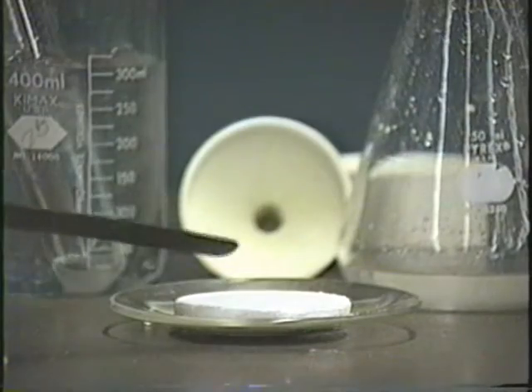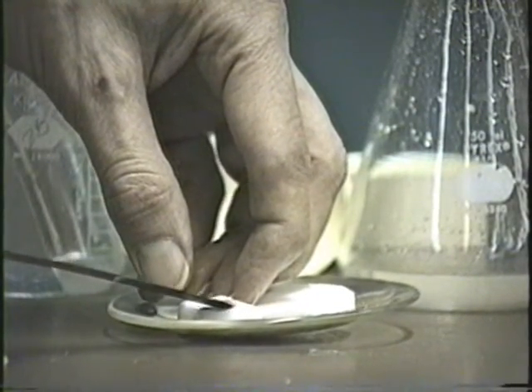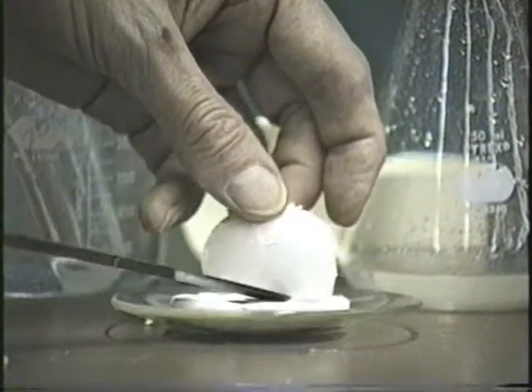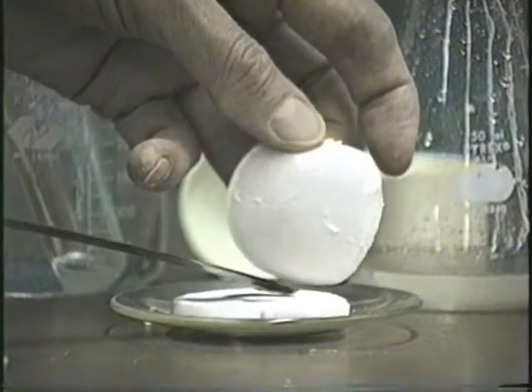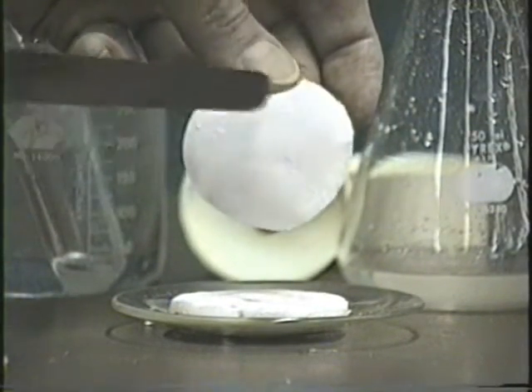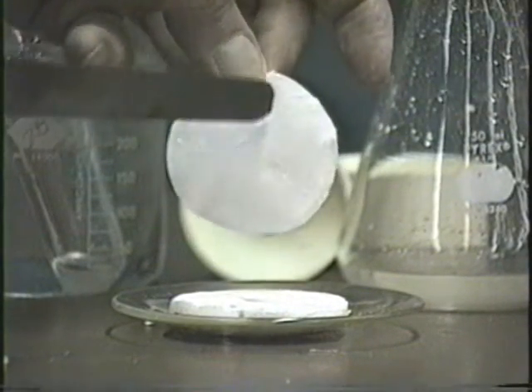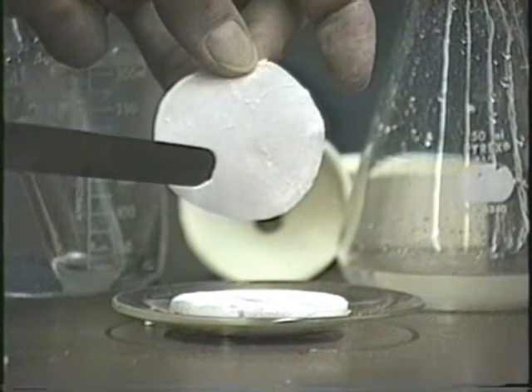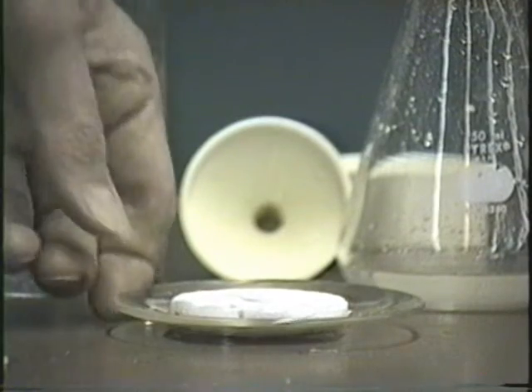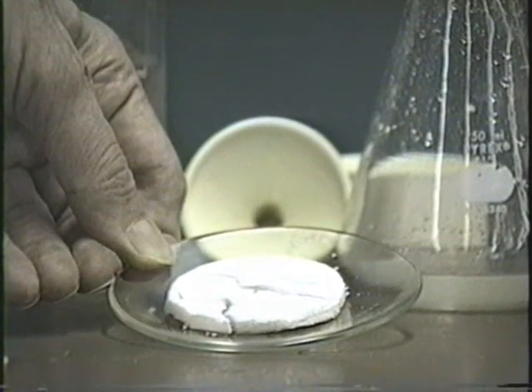But anyhow, once you have it on the watch glass here, make sure that you remove the filter paper. It looks like there isn't any filter paper here, but there actually is that one sheet of filter paper, so make sure you get that off. Or if you have 2 sheets, make sure you get both sheets off. And if there's any little flakes of sodium bicarbonate hanging on the filter paper, you can try and knock them off, but don't dig into the filter paper to get lint into your product. Well, there's your product, and it's all set to dry till next week.